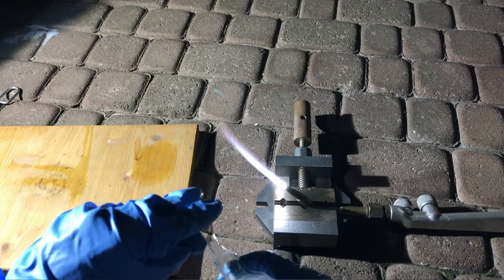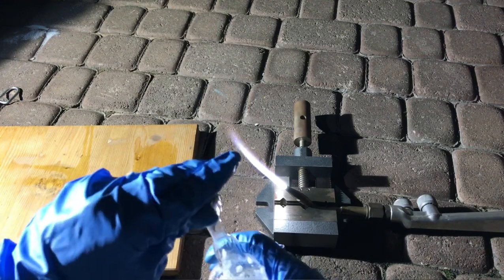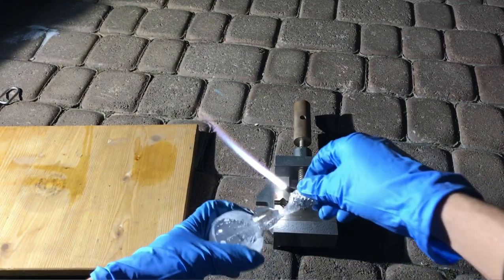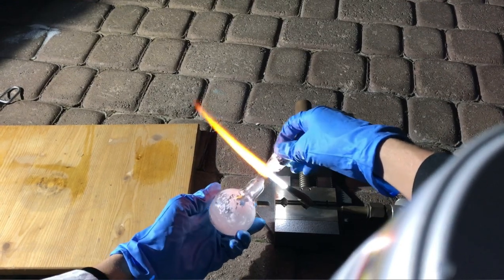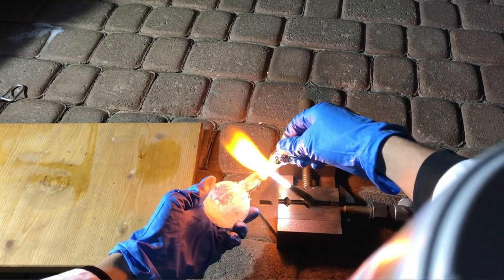Back outside again with the oxyacetylene torch. The ampoule was sealed shut. The sealing process actually went way easier than I thought and there was nearly no sulfur trioxide vapor leaving the ampoule.